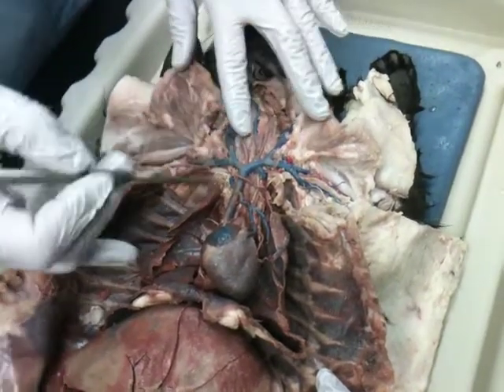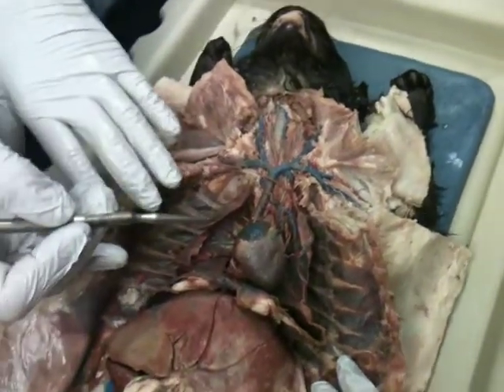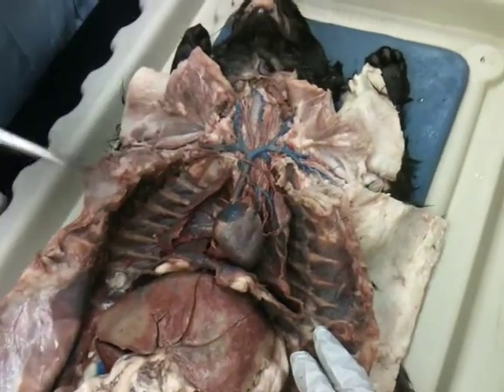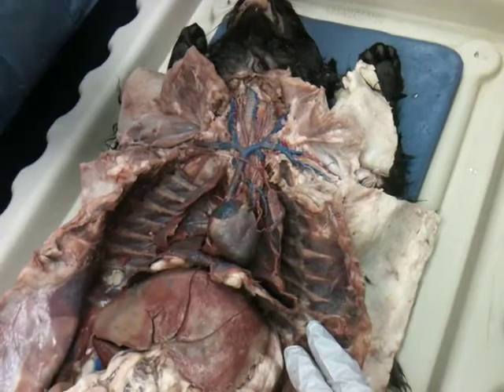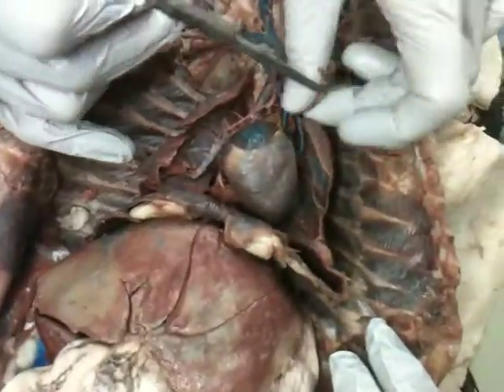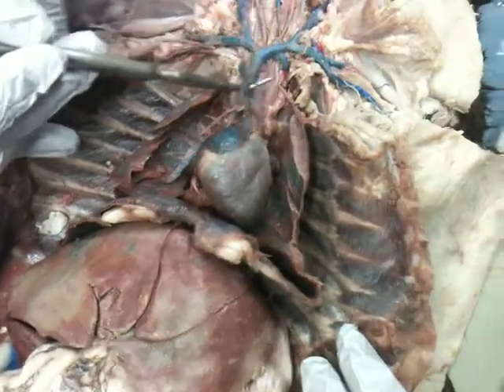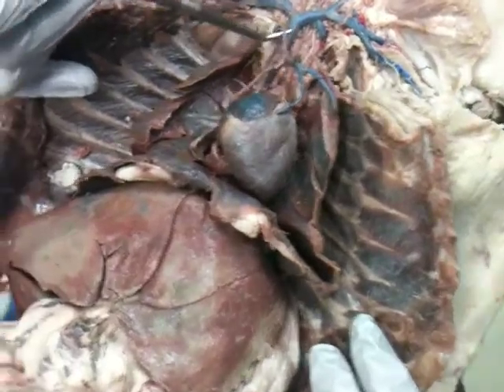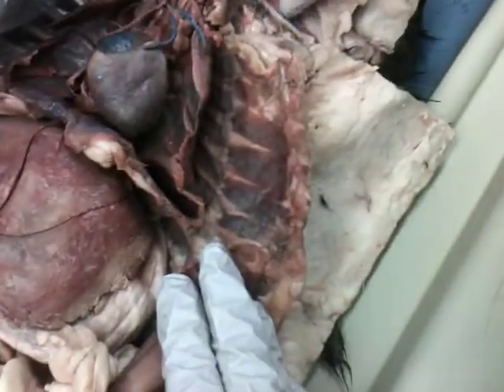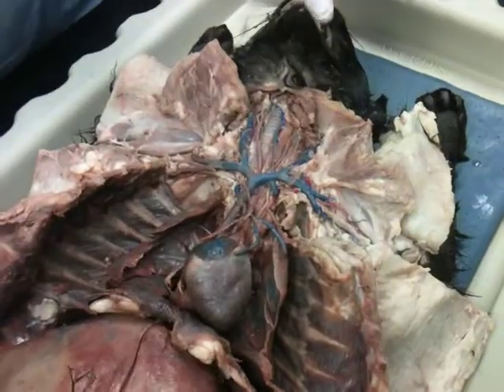Is there a long thoracic vein in there, or is it only the long thoracic artery? There are both long thoracic veins and arteries. Other cats show those better. This does show the mammary veins and arteries quite well, the internal mammary. So here we have the internal mammary vein, and I'll get here to the internal mammary arteries. But the long thoracic, I think, has been cut off over here. That one may be it. It's hard when it's broken off to tell exactly what it is.